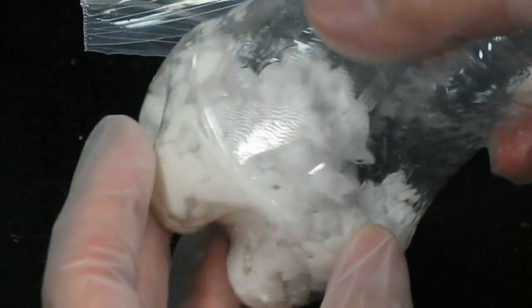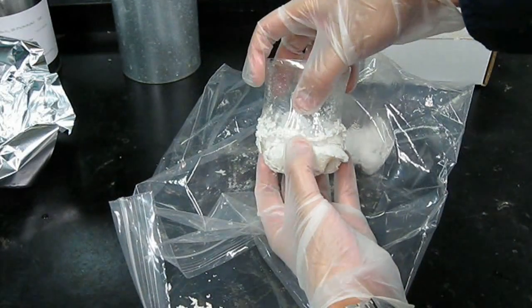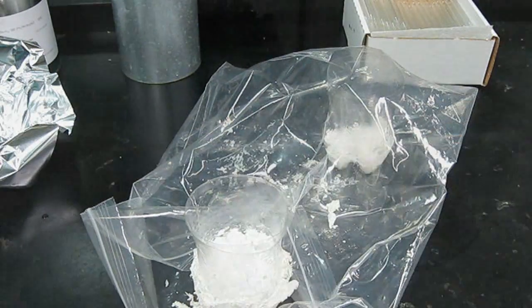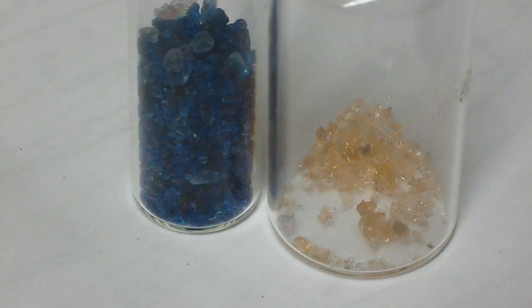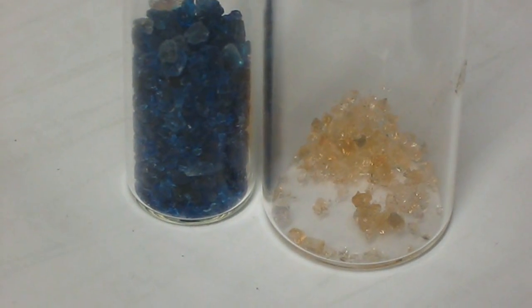Now the drying agent itself will not last forever. In the case of sodium hydroxide the indication is pretty obvious. If it liquefies it should be replaced. And if it starts eating through its container like this it definitely needs to be replaced as well as the container. Silica gel that has blue color indicator beads will turn pink when they're done. In the case of uncolored beads you'll just need to eyeball it and replace the beads when it stops drying properly.